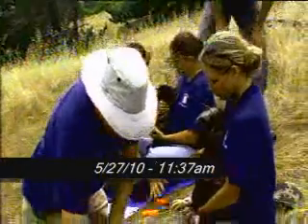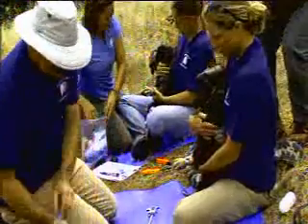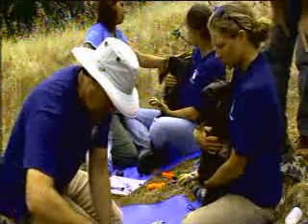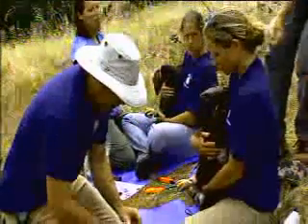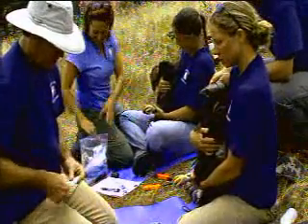The next step is drawing a little bit of blood for contaminants analysis and also for sexing of the bird. We can send in the DNA and have each bird know for sure what sex it is.